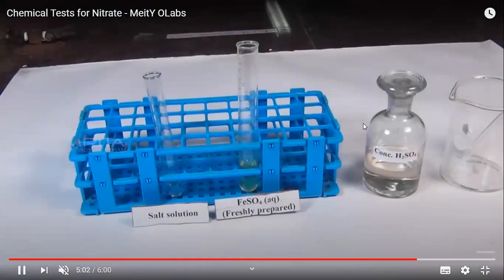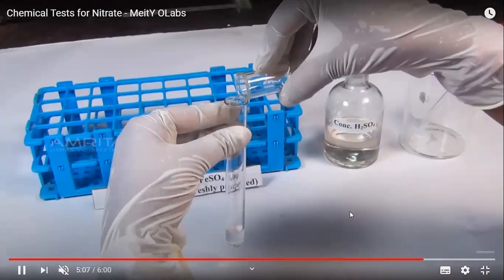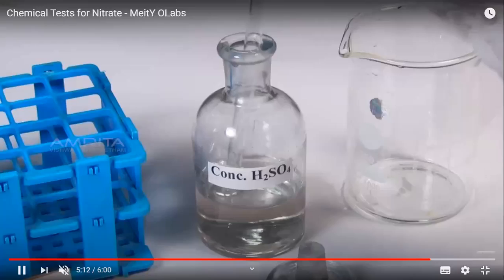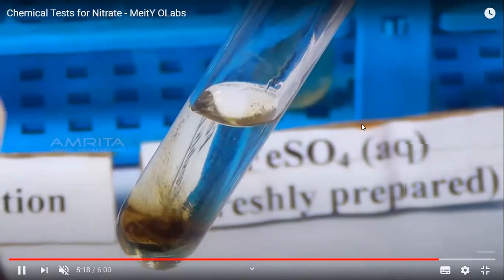Now let us perform the test. First we take a test tube. In this test tube we have only the salt solution present in it. You can see the salt solution. Now we are going to mix it with the freshly prepared FeSO4 solution, which was green in color. Now you can see that we are going to add the concentrated sulfuric acid into this mixture by touching the wall of the test tube. You can see that it is added very slowly, and you can see the reaction takes place.